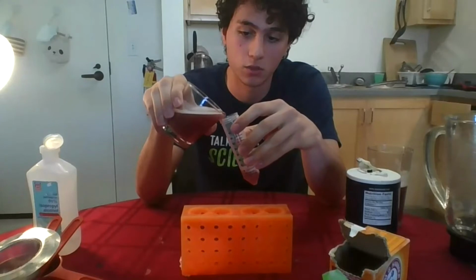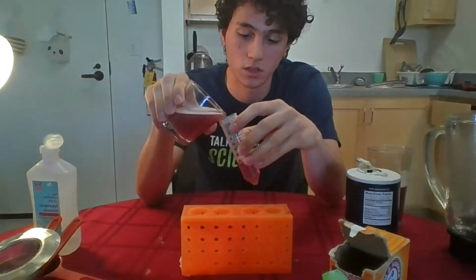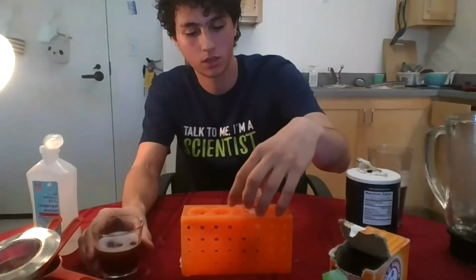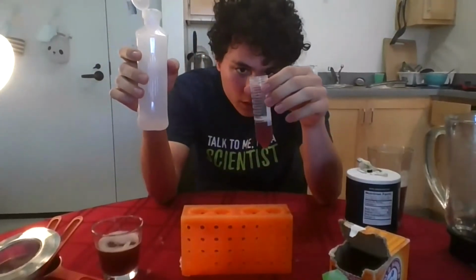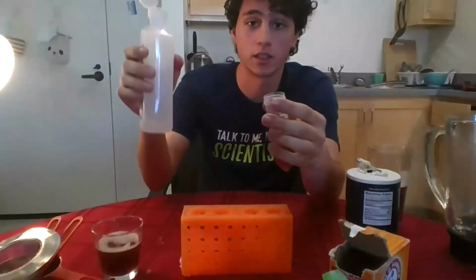And it's working. There. So I get some bubbles, and you probably will not be able to avoid it either, but I have the strawberry blend inside the test tube. Now what I'm going to do, I'm going to take the chilled rubbing alcohol. I'm going to wait a little bit for these bubbles to disappear. Now I'm going to add the rubbing alcohol.